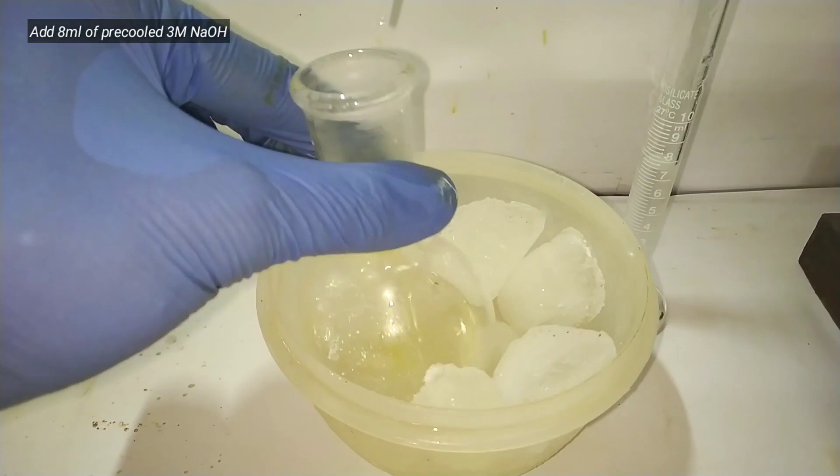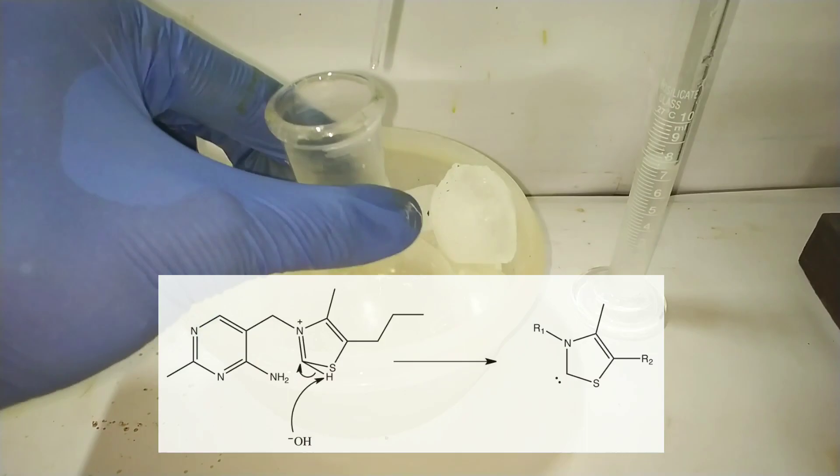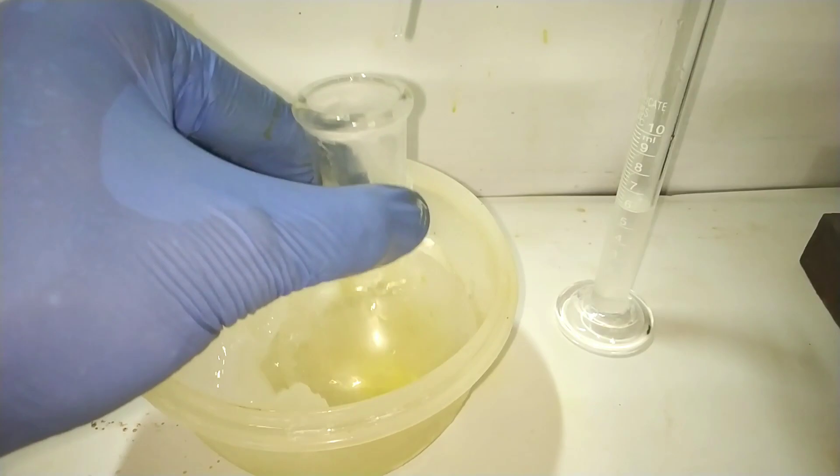A yellow colored solution is gradually formed. What is happening here is sodium hydroxide attacking the thiamine and deprotonating it. There is formation of a carbene, which is very reactive.